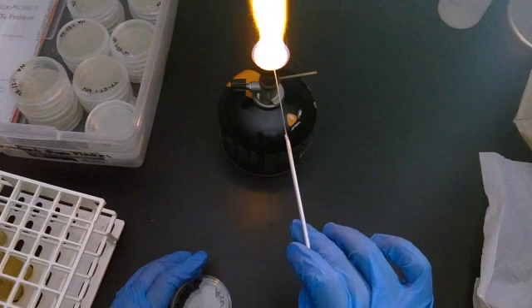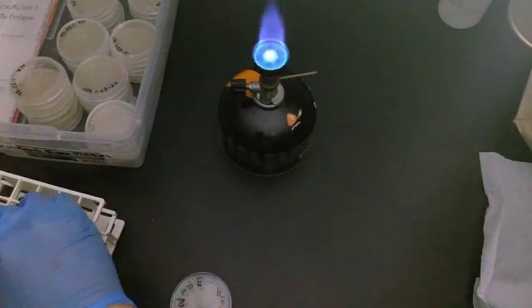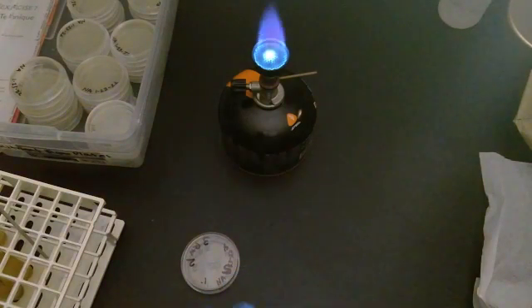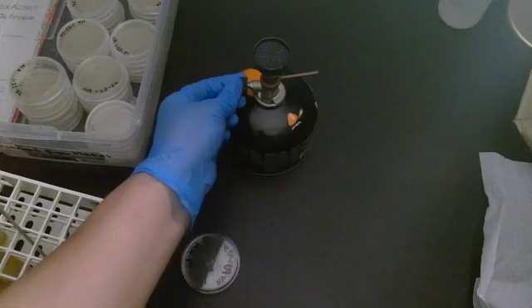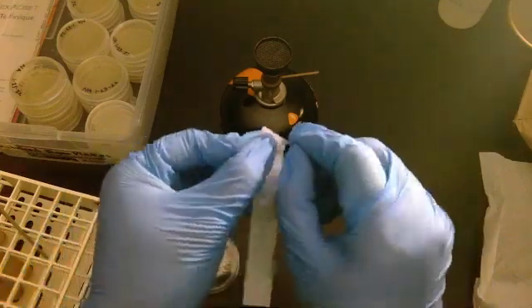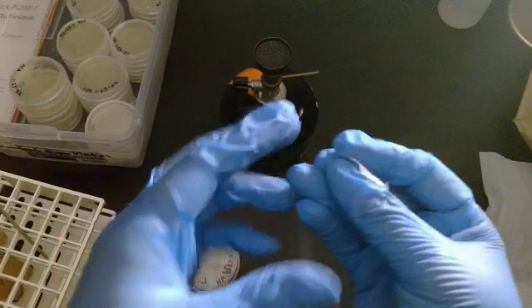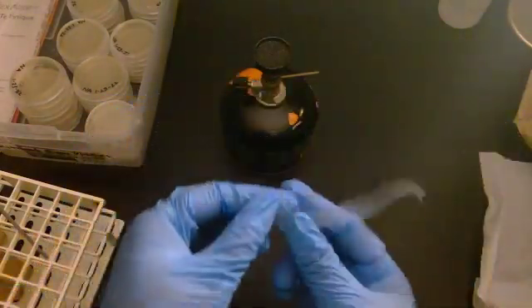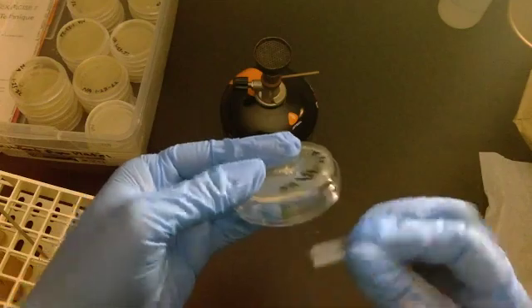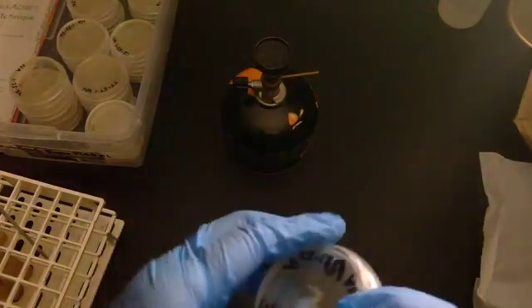Since it's the last one, I want to make sure I flame it thoroughly. Now that I'm done, before you put it in the incubator you put parafilm. I'm done with my loop so I can turn this off now. This is parafilm. It's got a paper backing—pull the corner and you can peel the paper off. Put your thumb down on it, make sure it's covering the connection between the top and the bottom, and seal the plate.